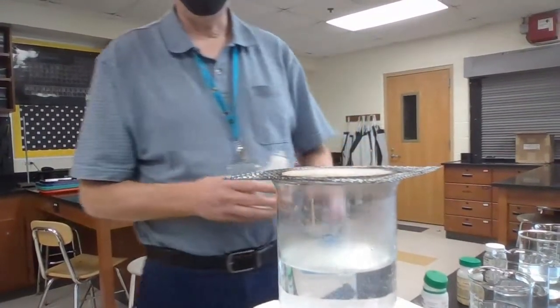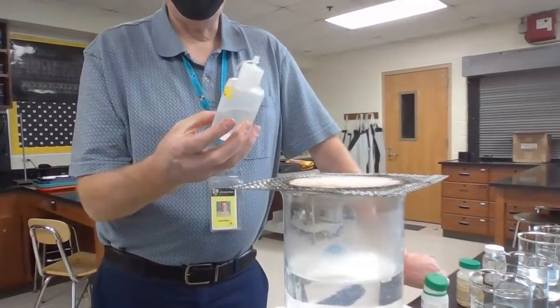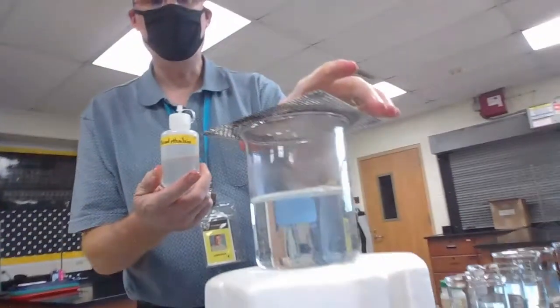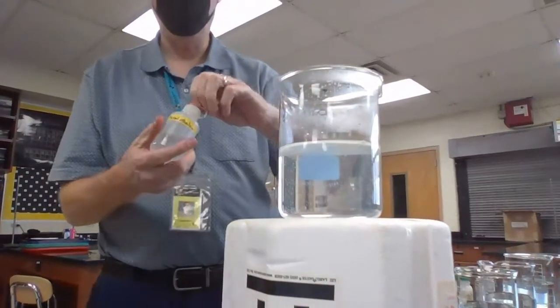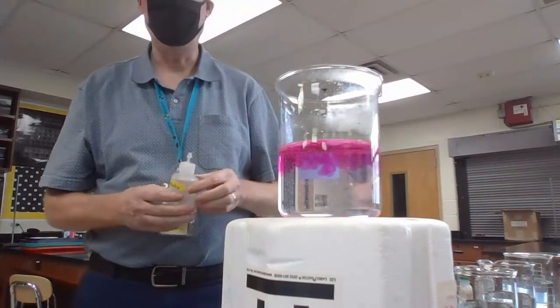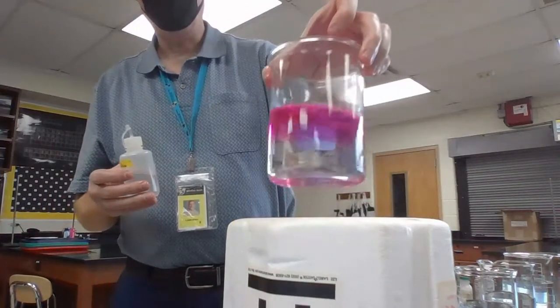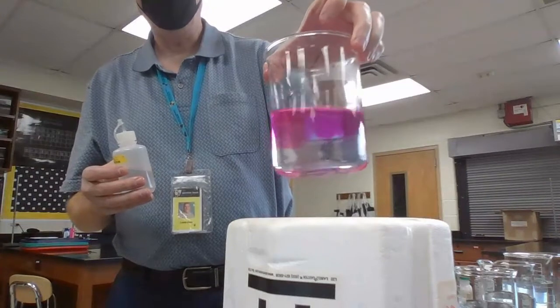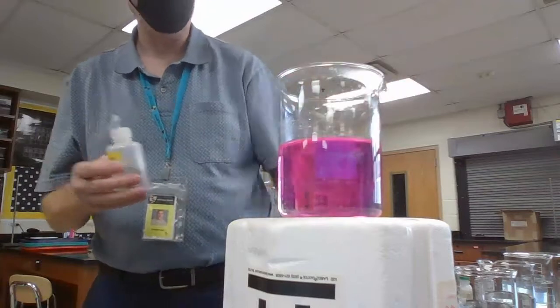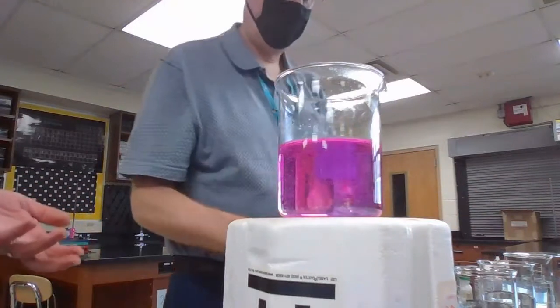One thing we're going to do to this as well is add this chemical called phenolphthalein. In the presence of a base, it will turn from clear to this pretty pink-purple color. And so the solution we made is basic. I can swirl that in a little bit, and we get a nice pretty color. So our metal is reacting with the water to make a new compound, which turns our indicator pink.